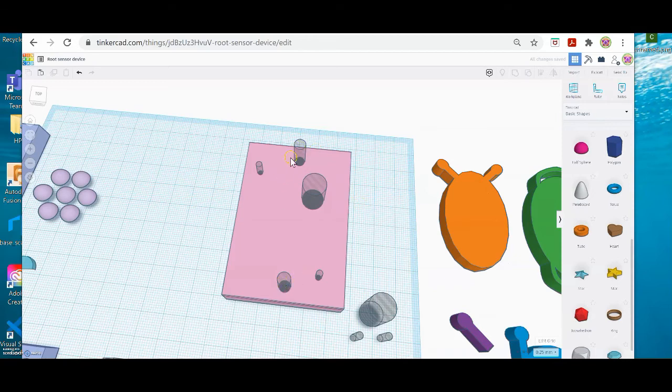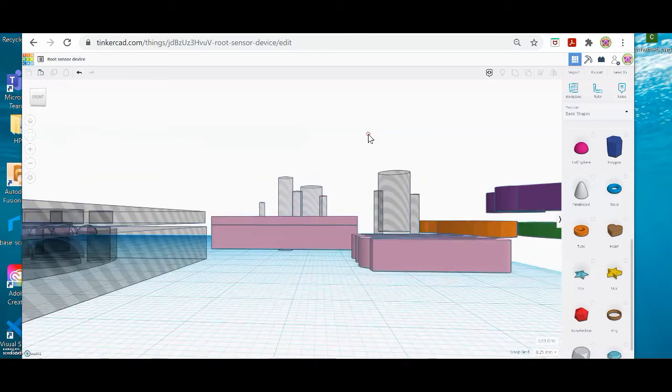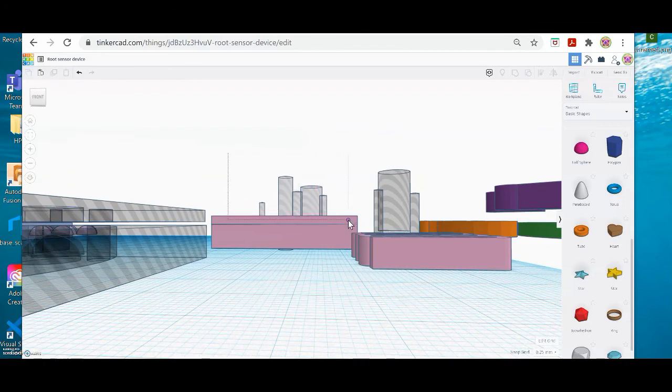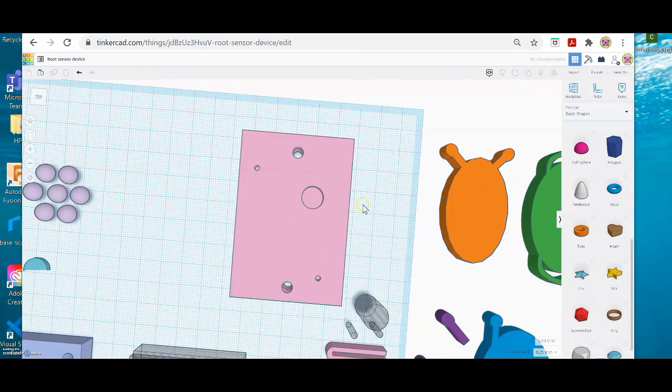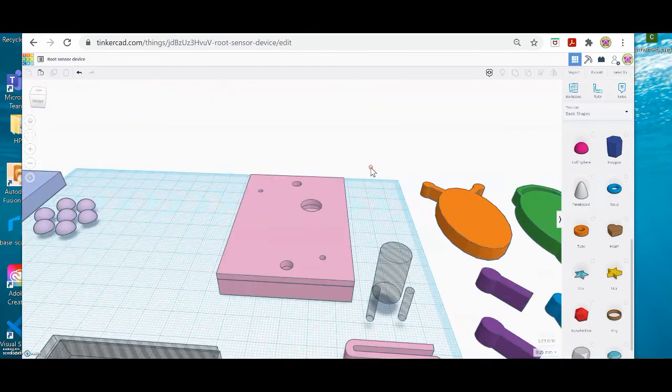These 2 holes, top and bottom, are going to be ones that go all the way through, so I can maybe sew it down or attach it to something. These 2 in the corners are port holes that fluid's going to be dropped into, like the fertilizers. And then this bigger hole is for the seed. Okay, so I'm going to pitch sideways, and now I'm just drawing a selection box around the objects that I want to group. Go back up to group. And now when I look at it, this is what it looks like. And that's exactly how I want it.